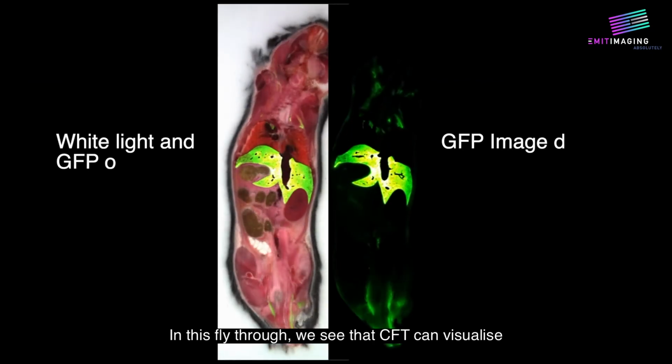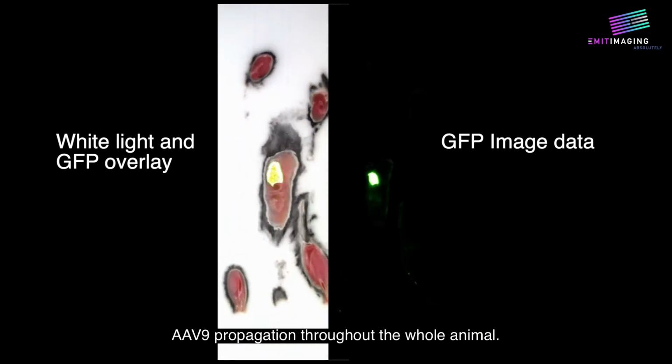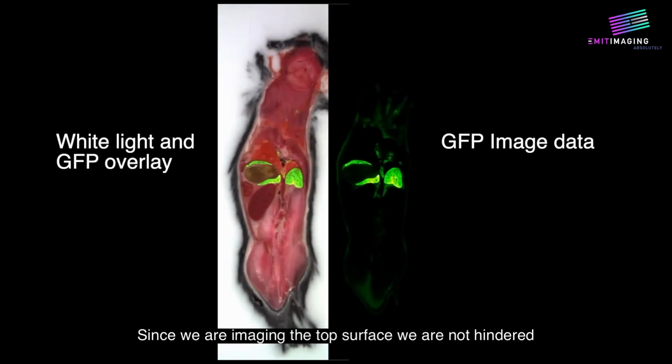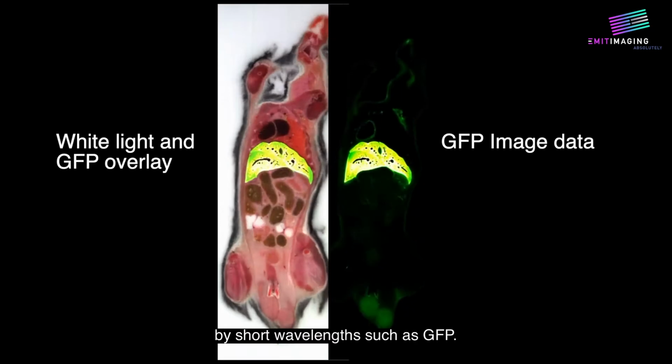In this fly-through, we see that CFT can visualize AAV9 propagation throughout the whole animal. Since we are imaging the top surface, we are not hindered by short wavelengths such as GFP.